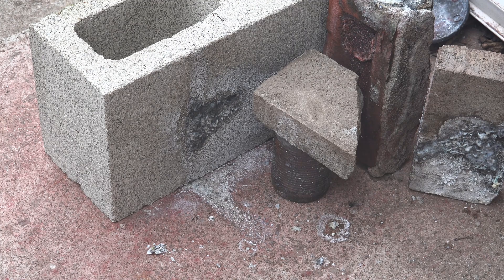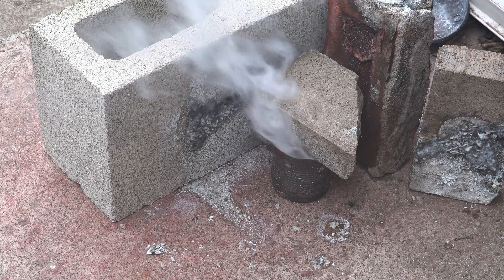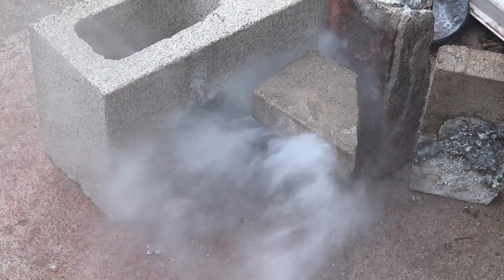I recommend doing it this way for your runs, although make sure the sparklers are long enough that you have time to go to a safe distance. Shooting flames is not fun. Actually, correction — shooting flames is lots of fun, but only if you're safe while doing it.